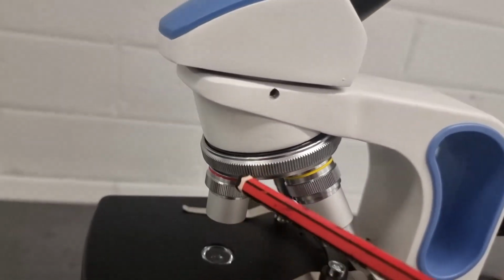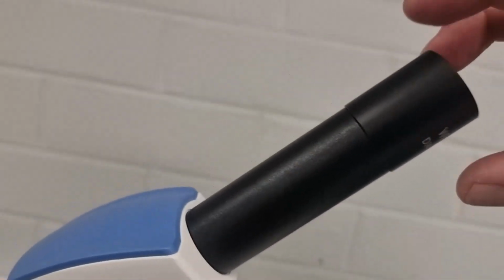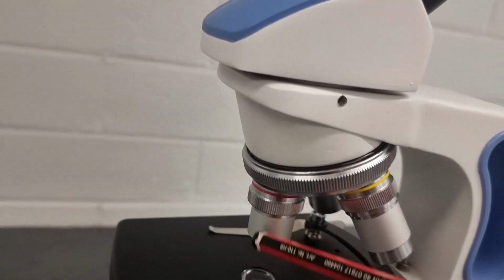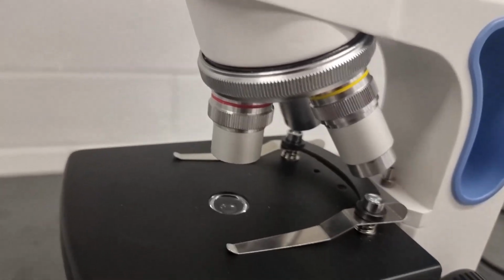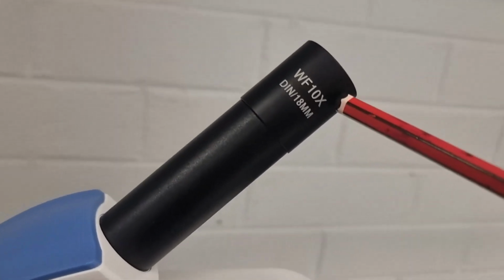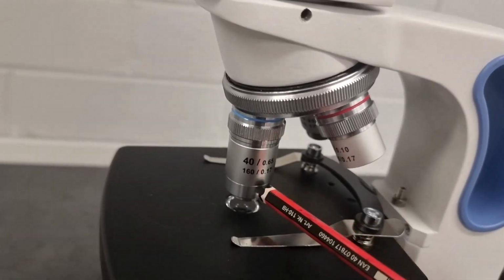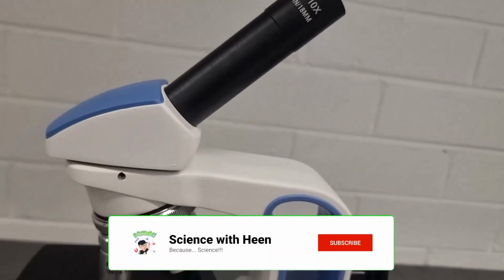Now, as I mentioned, the light comes up through those objective lenses, through the barrel, and to the eyepiece. Now, the eyepiece is actually magnified as well, often 10 times, sometimes 12.5. We can see this lens is actually a 10 times magnification. What this means is that on the 4 times objective lens, what you're observing isn't actually magnified times 4. It's magnified times 40, because we need to take the magnification of the objective lens and multiply that by whatever the magnification is on the eyepiece. So that gives our total magnification. So the strongest magnification on this microscope, the objective lens is 40, but we multiply that by the eyepiece. So we can actually magnify 400 times with this microscope here.